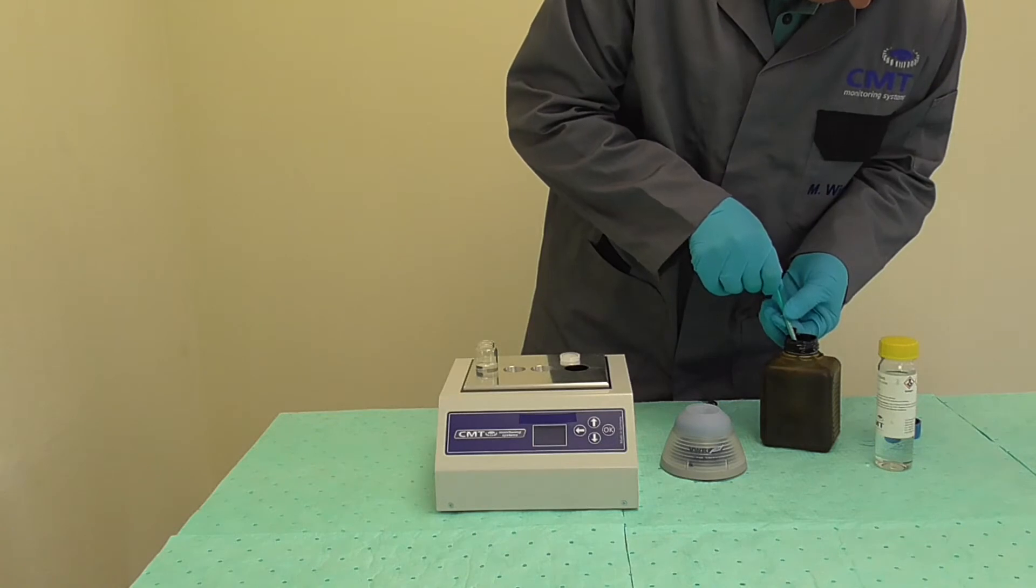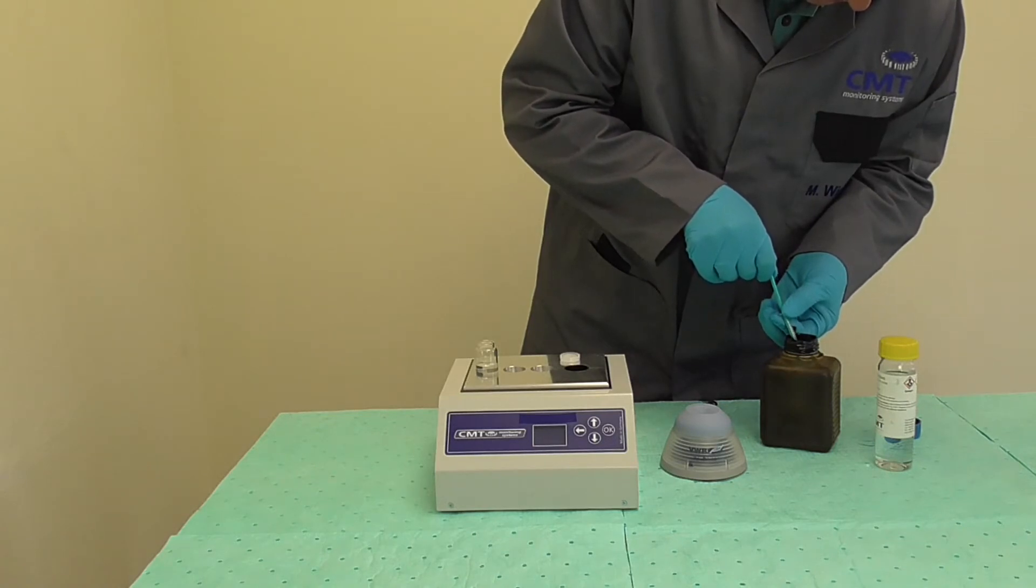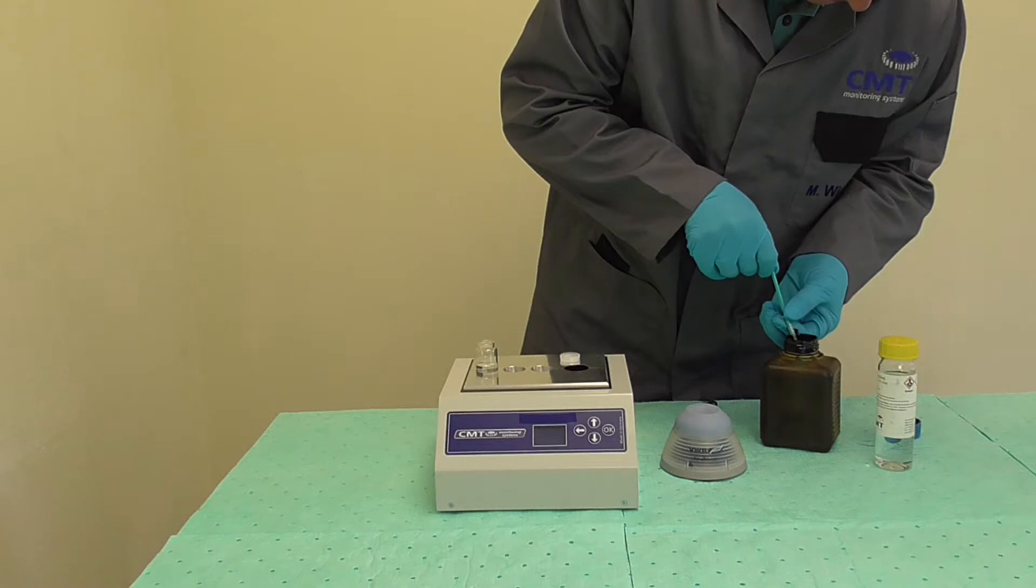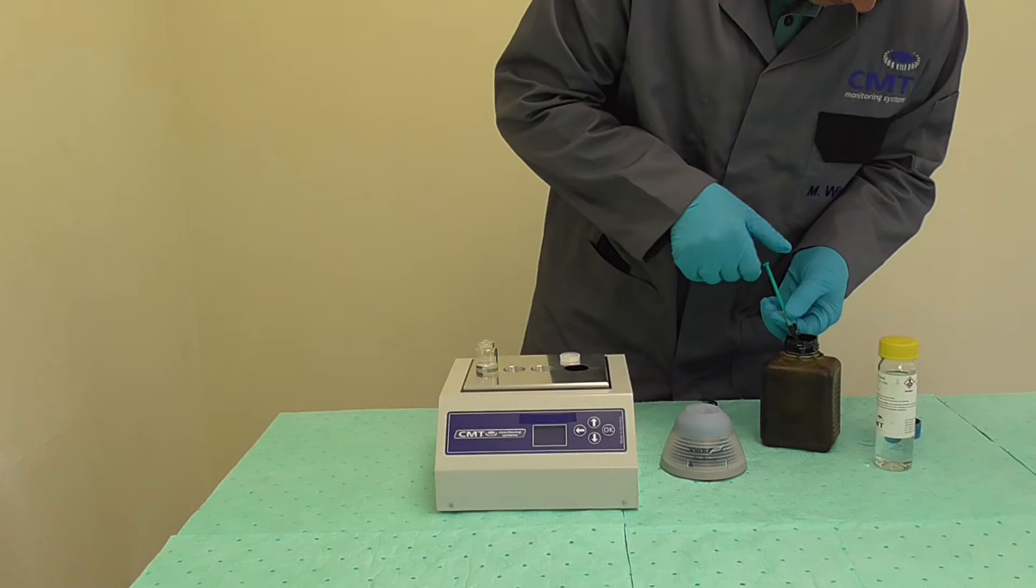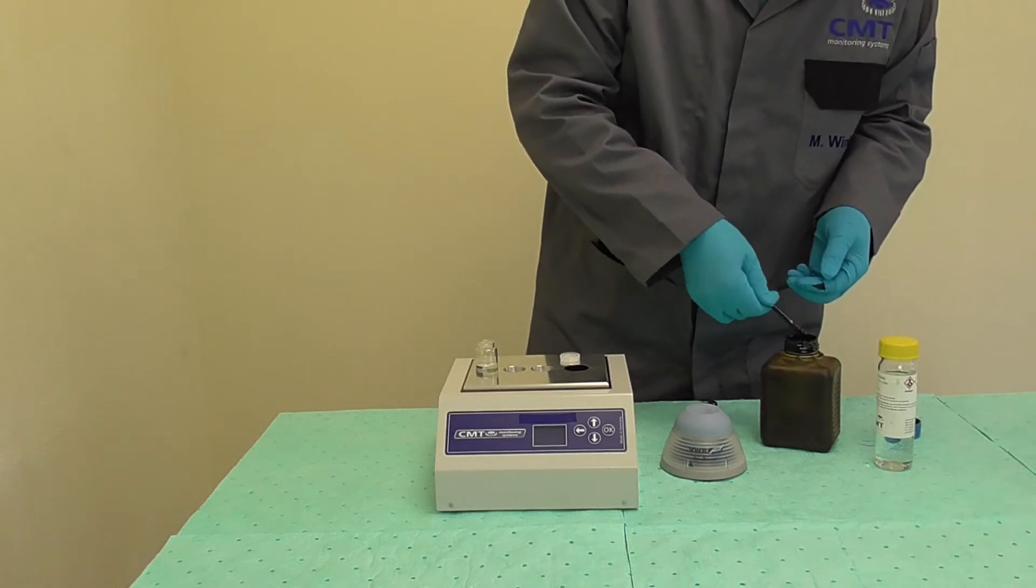Make sure you have no air in the syringe to avoid air underneath the plunger.